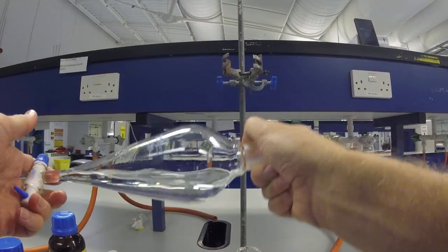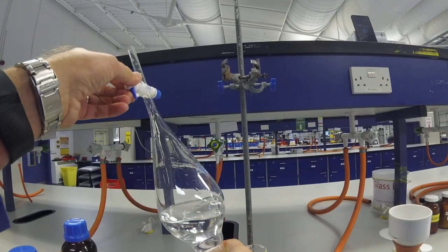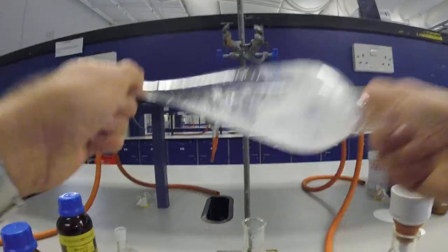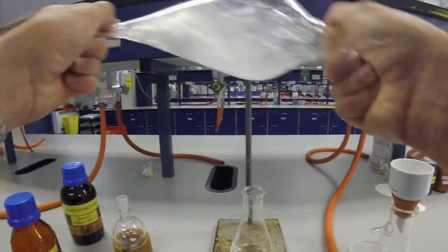Turn it over and then open the tap and you could hear that, the release of pressure. Then you're going to give it a shake, really good shake.